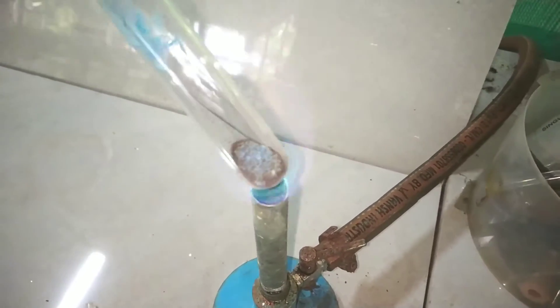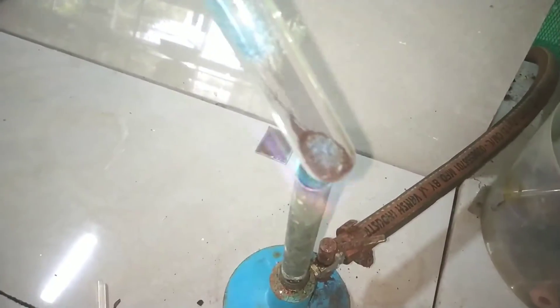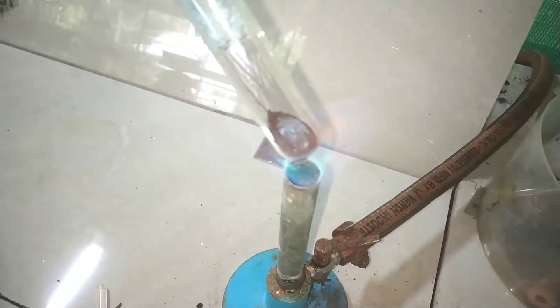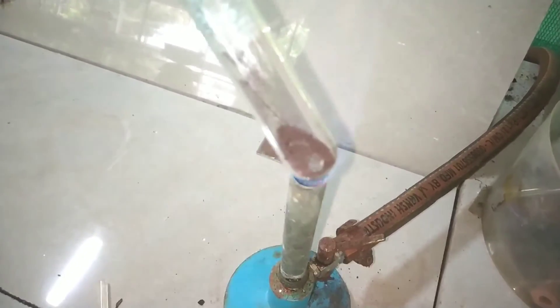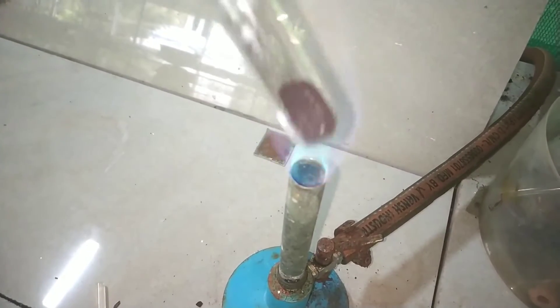What is actually happening here is the copper 2 citrate is decomposing to form copper metal. The metallic copper is formed as a fine powder in the test tube. Because we have the cotton wool on top, it is not reacting with the oxygen and is present as such.